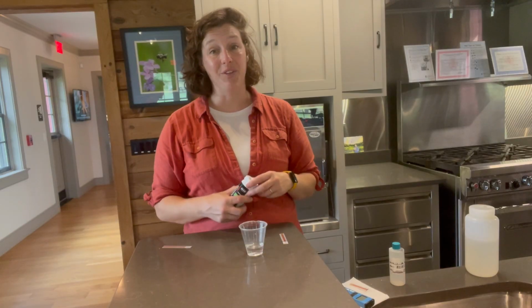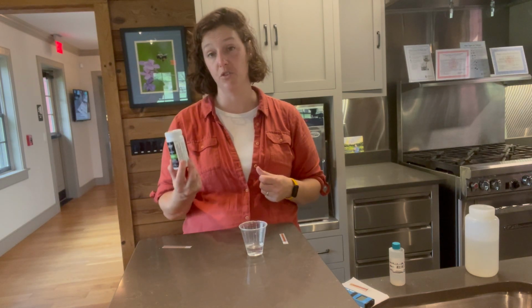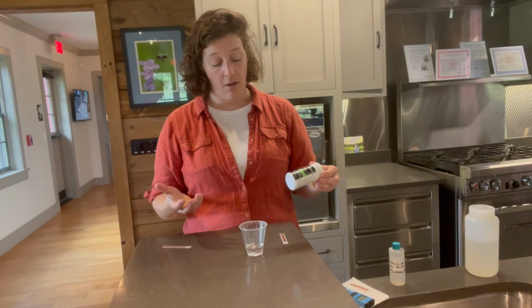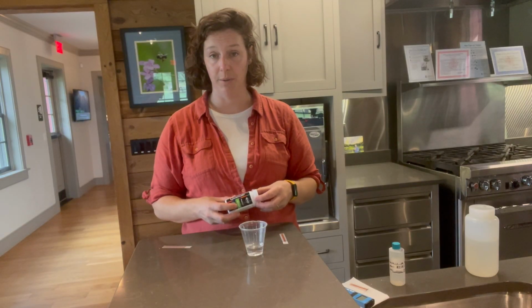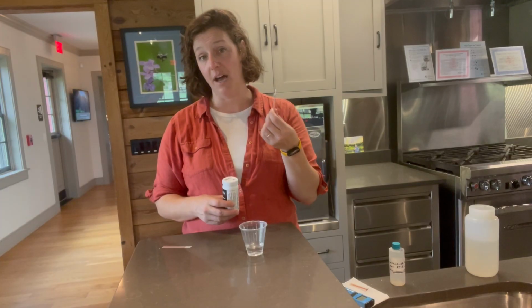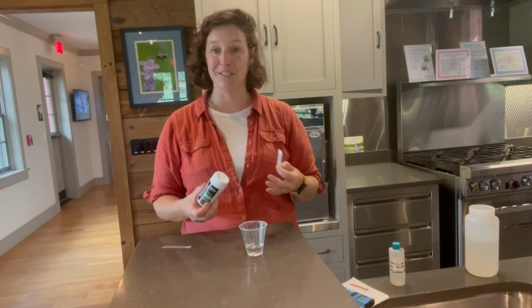Don't panic. If you're worried that you might have not done a proper testing, you can always run another strip on a fresh sample. So hopefully you're getting readings that are below the detectable limit, but especially if you're going out during winter storms, you can often find that we'll max out our test strips, and that's important data, even if we don't have the percentage or the parts per million.